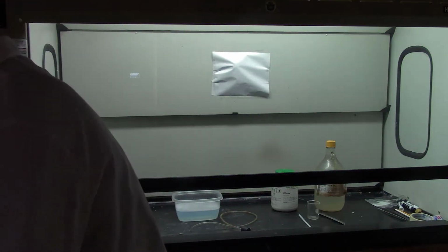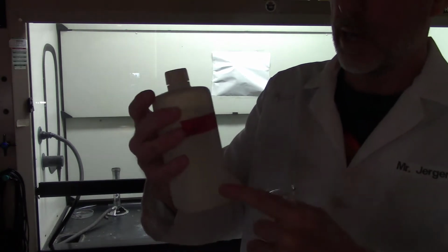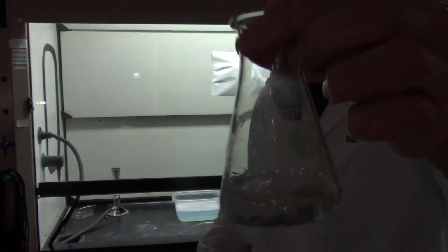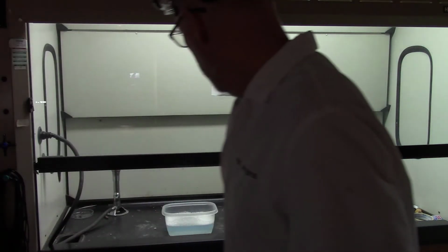When we get to stoichiometry, we'll be measuring that out and we'll figure how much we're going to make. So we got the mossy zinc in there, and it has a lot of surface area, so it should react pretty well. And then we'll also take some hydrochloric acid, which is an aqueous compound. It's dissolved in water, it's clear. We'll add some of the acid. Maybe you can even hear it. And you can see those bubbles that are being made. And we're going to catch those, whatever the bubble stuff is. Actually over here, I've got a reaction that's been going for a while, that we'll use.